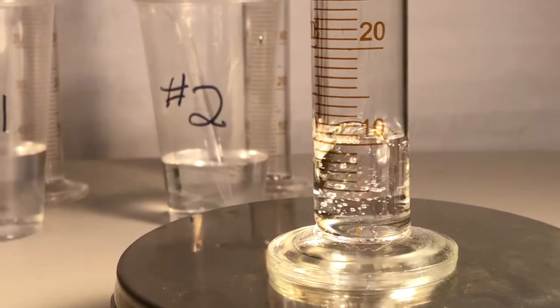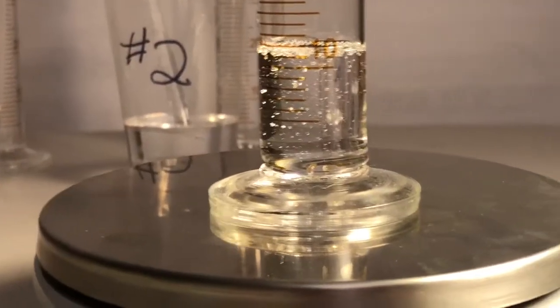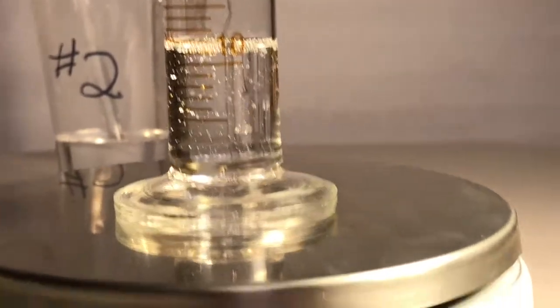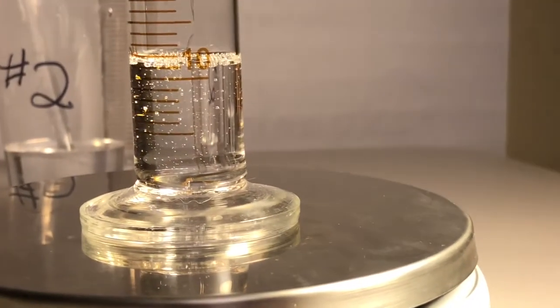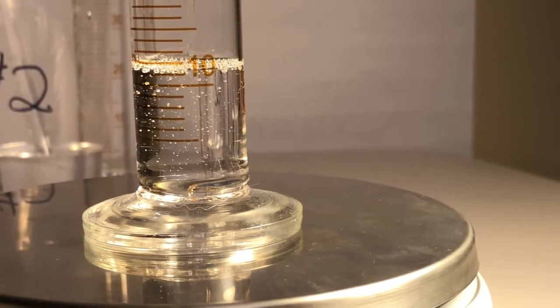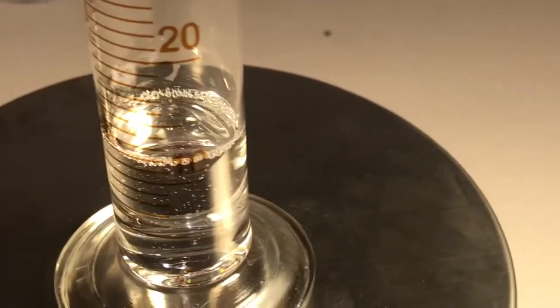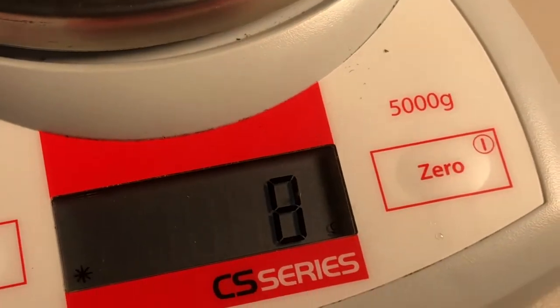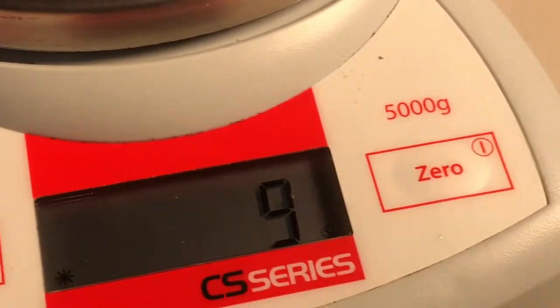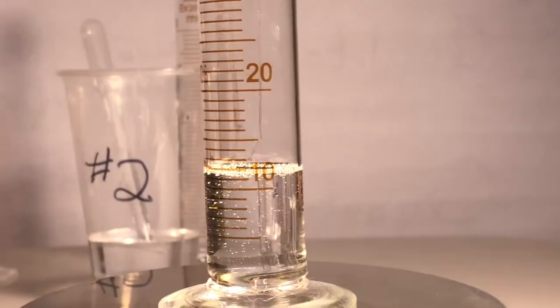With a big kersploosler. Clear liquid that doesn't behave the same. What's that number? The plus or minus maybe got a little bigger with these reads, huh, you guys? Lucky we're not worried about that too much. What's that say? Interesting. Oh, got it. All right. Here comes number 3.